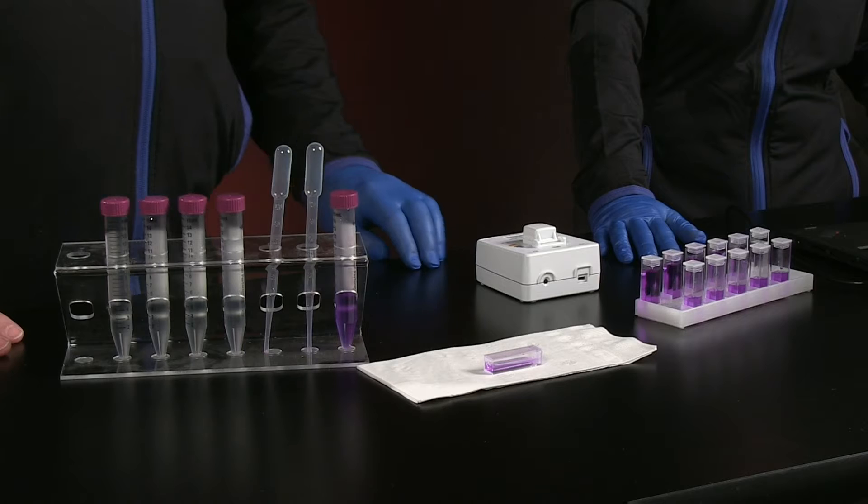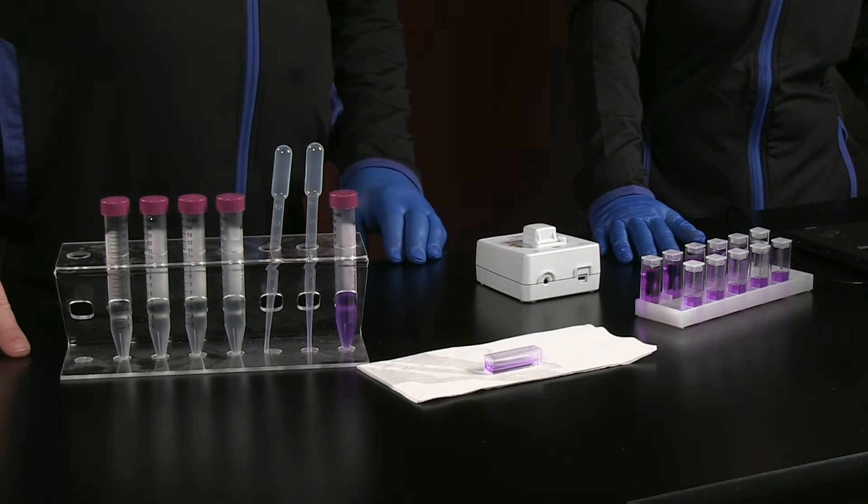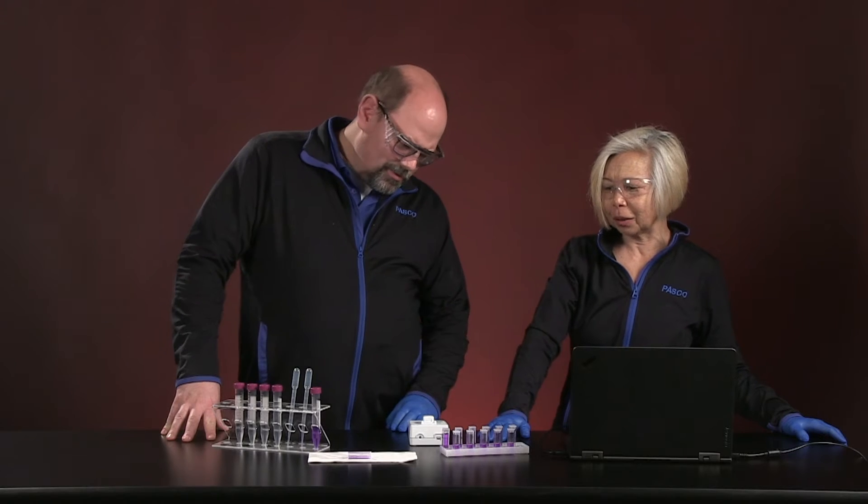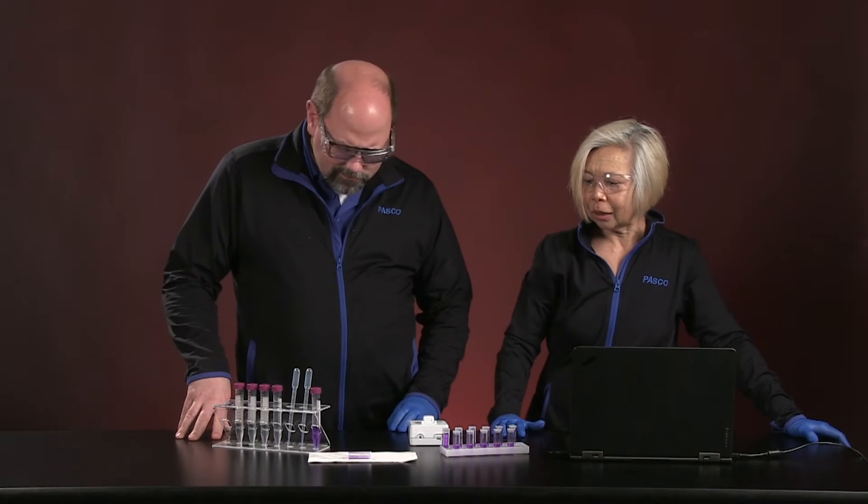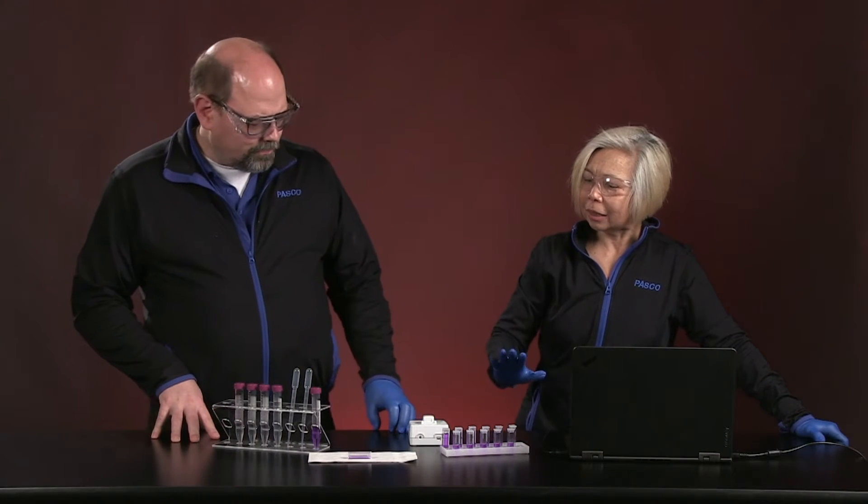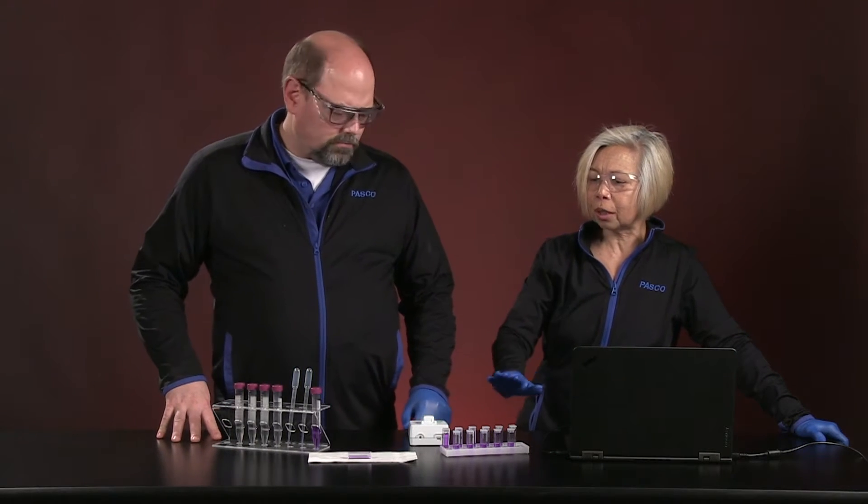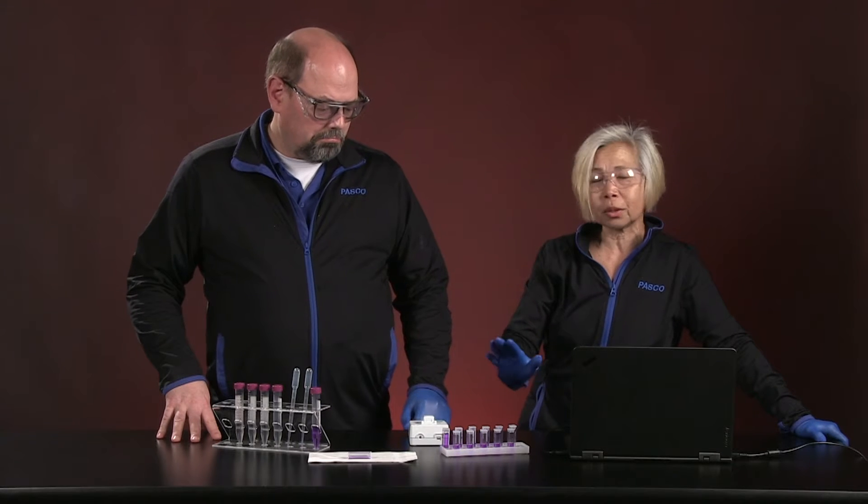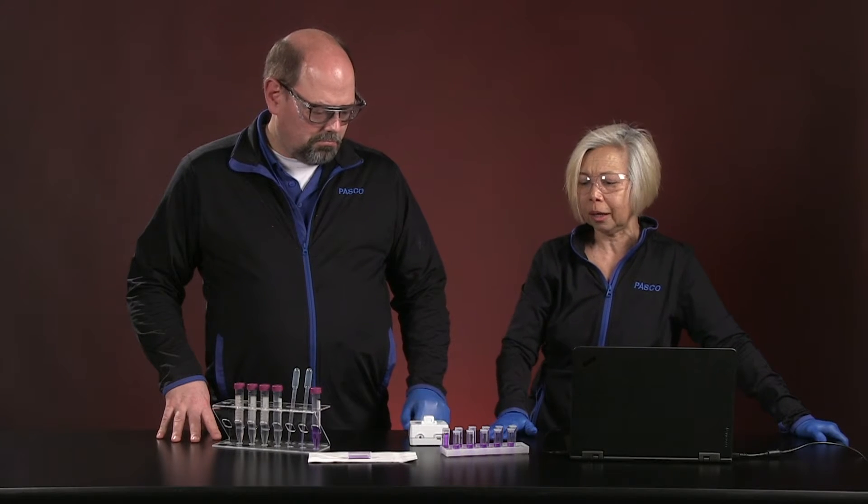Wow, what cool colored materials do we have here today? I know, this is purple, it's my favorite color. What you're actually looking at is crystal violet. It's a dye that's used to study tissues under the microscope, so it's called a histological dye.